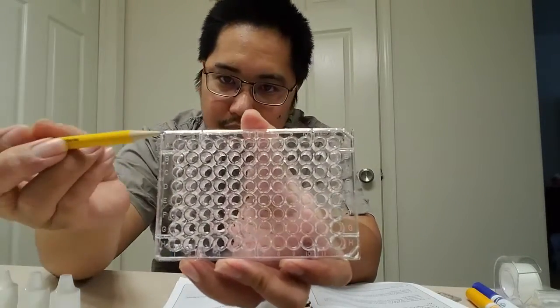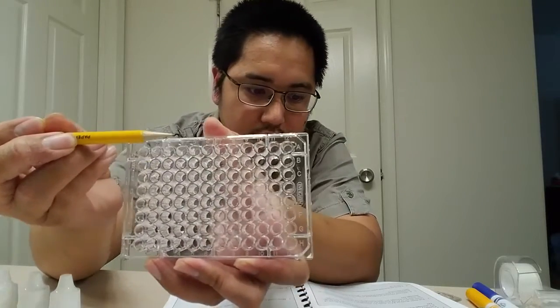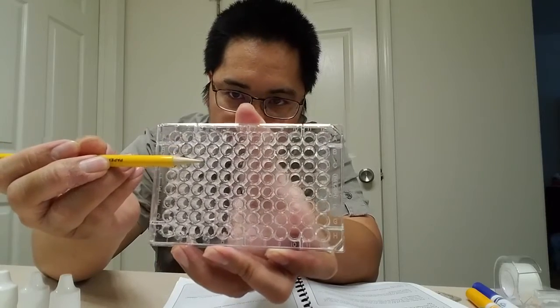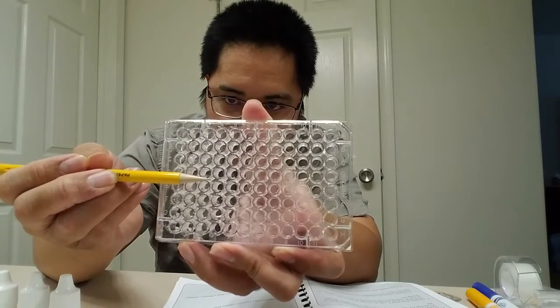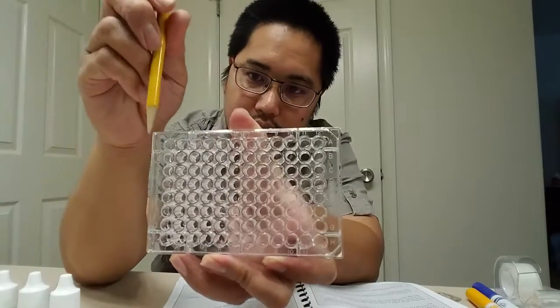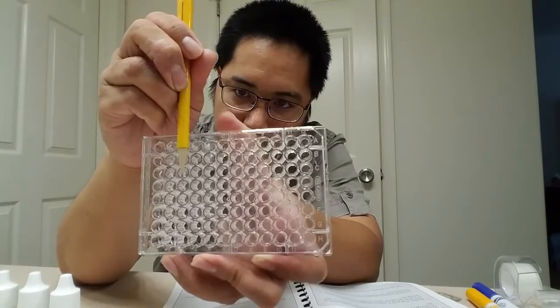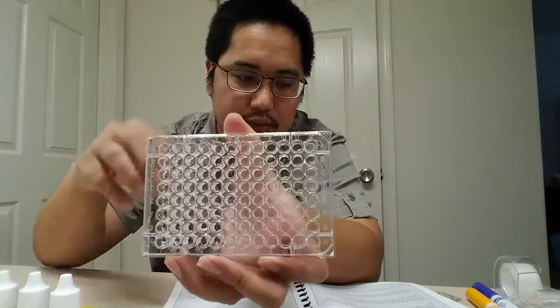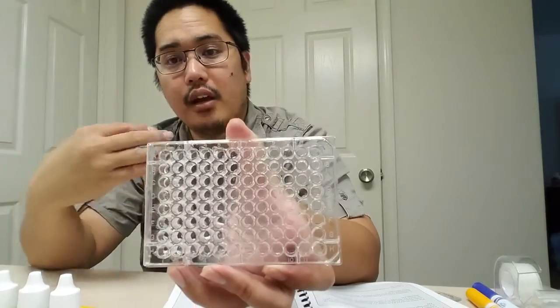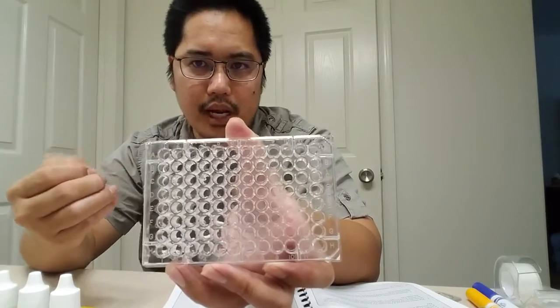So we're going to put one chemical that goes all the way across, then another chemical that goes all the way across, and so on for four rows. Then we're going to take other chemicals and go down the columns, a different one in each. We'll have a grid of 16 different mixtures, and we're going to see which ones actually undergo a double replacement reaction.